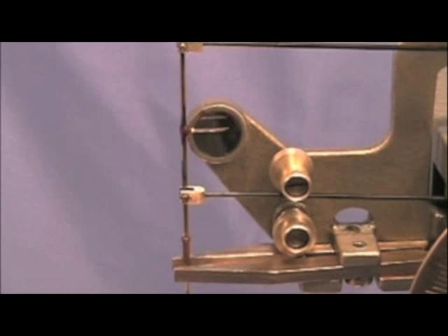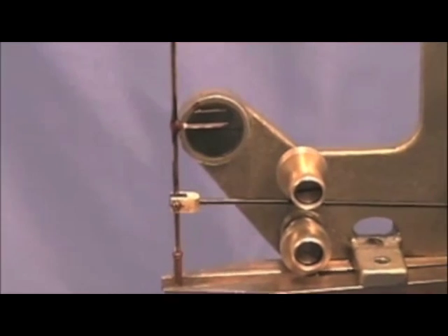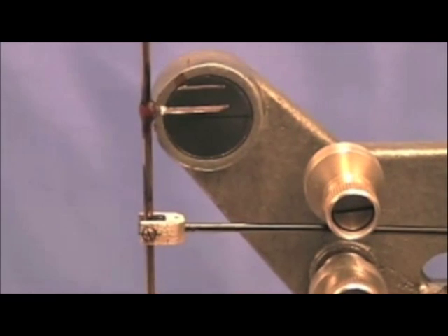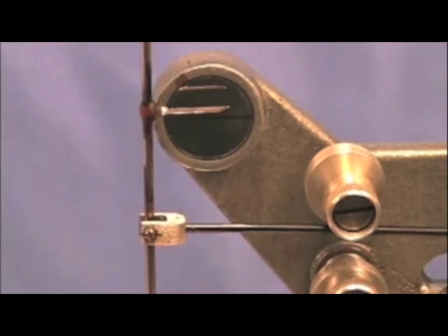Using a method of first lowering the sample stage with the left hand and then using a countering adjustment with the right hand to maintain the ring alignment with the mirror indicator line is important to calculating a final result.